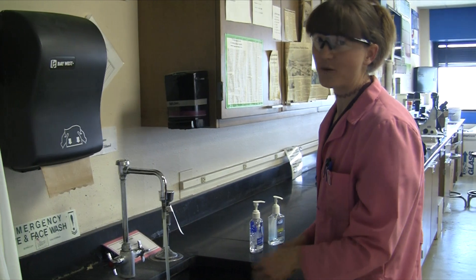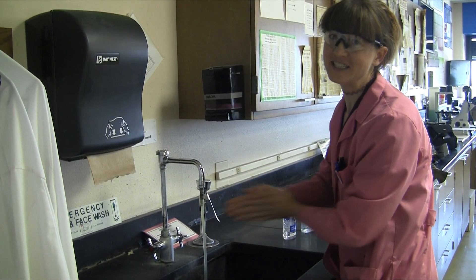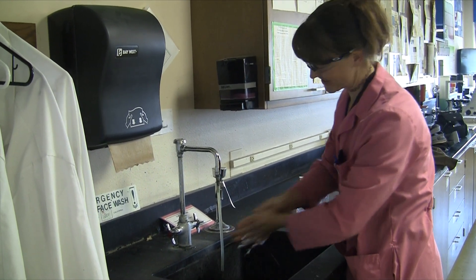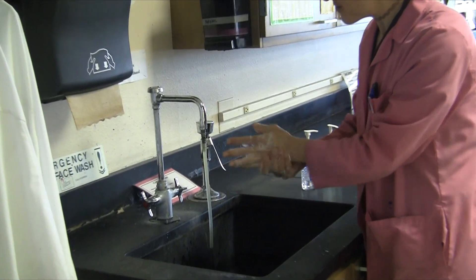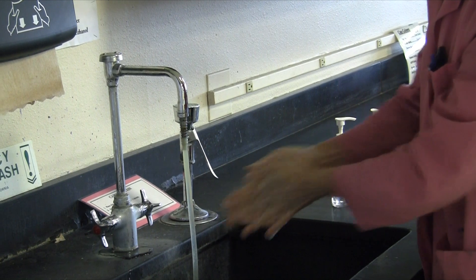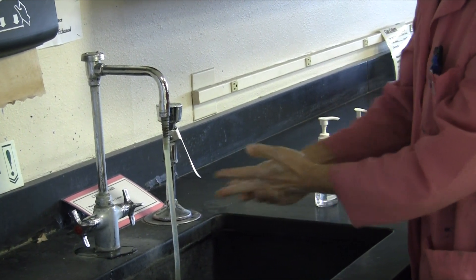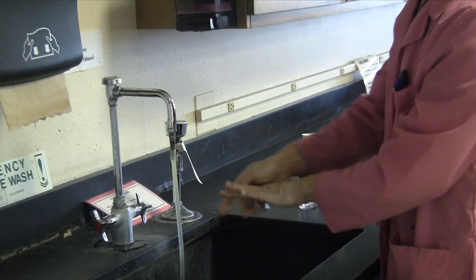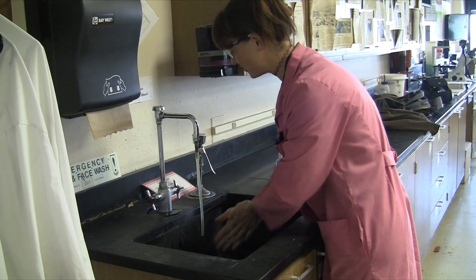If you're doing the hand washing experiment, make sure to wash your hands for at least a minute. We're trying for good mechanical action, so lots and lots of scrubbing. Wash all areas of your hand and really scrub. Get a look at the clock and do a full minute of mechanical action, then rinse and dry as you normally would.